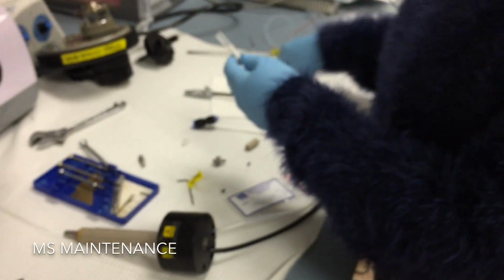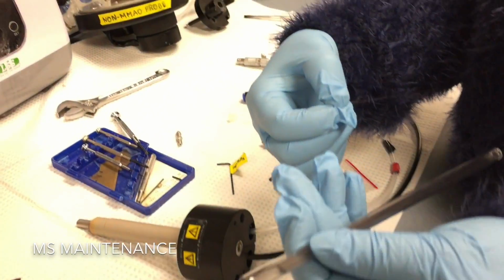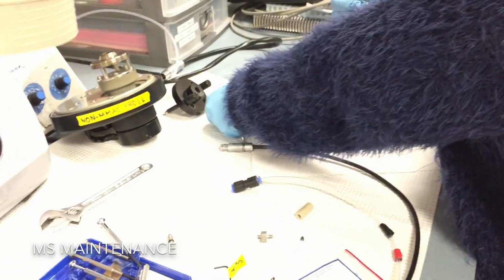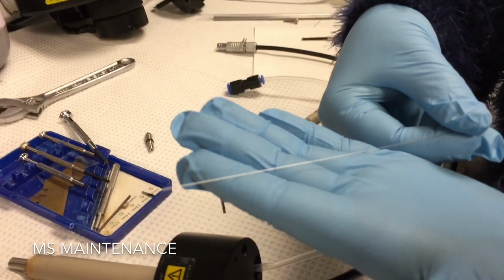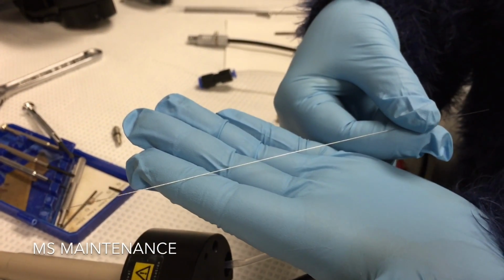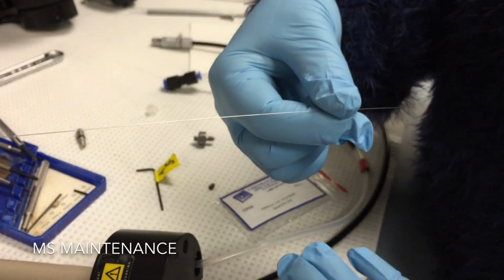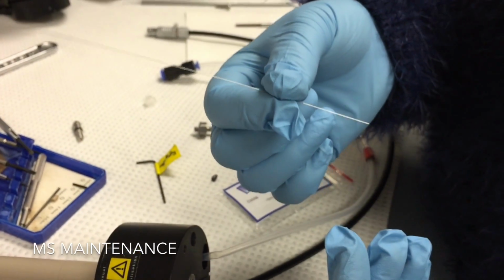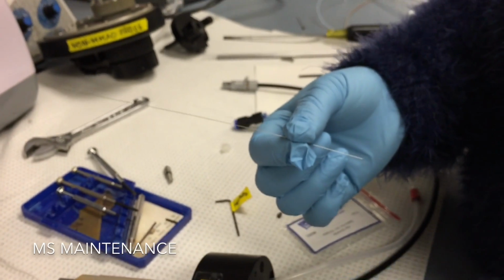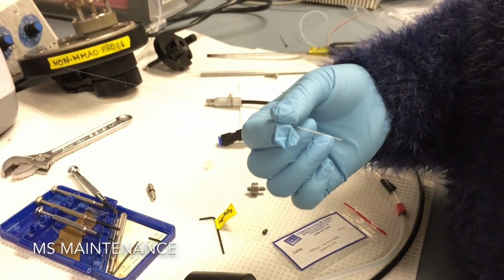Alright, so now I'm going to take a new capillary out of our stash that we have. This is a stainless steel capillary. It has a very small inner diameter. I think it's about 125 microns. The outer diameter, as I said, is about 250 microns. So the first step in changing the capillary is you should always touch it just using gloves. You don't want to contaminate it with fingerprints and whatever else you might have on your hands.